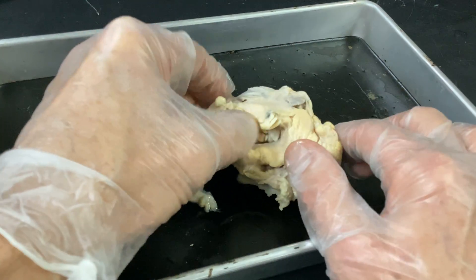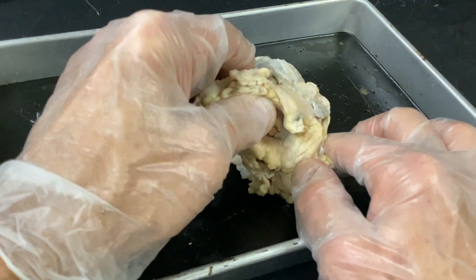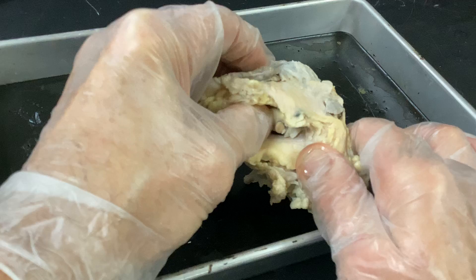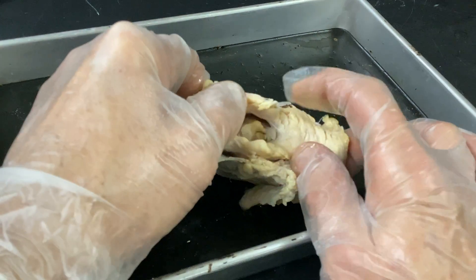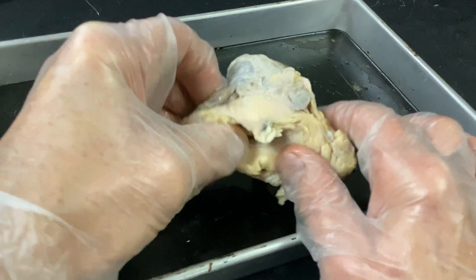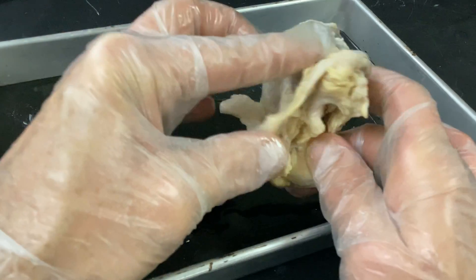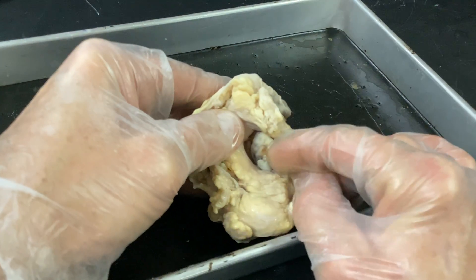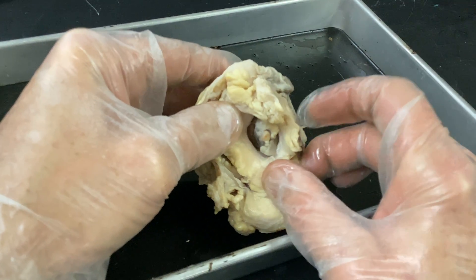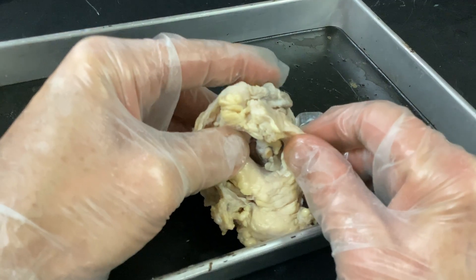Remember, you're going to have a superior oblique, inferior oblique. Rectus always means straight — you'll have a medial rectus, lateral rectus. Superior oblique is going to have something to do with the trochlear nerve. Just when you're learning the cranial nerves, have an idea of what they generally do. Cranial nerve 1 and cranial nerve 2 are pure sensory — olfactory and vision.